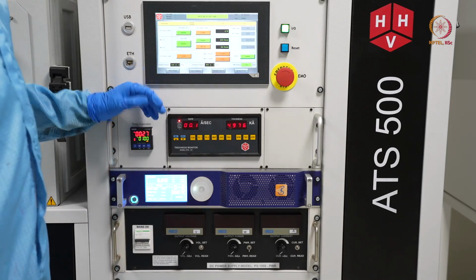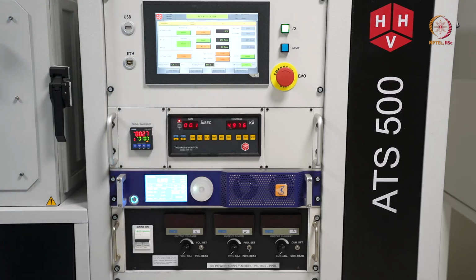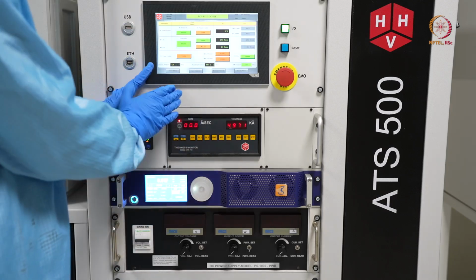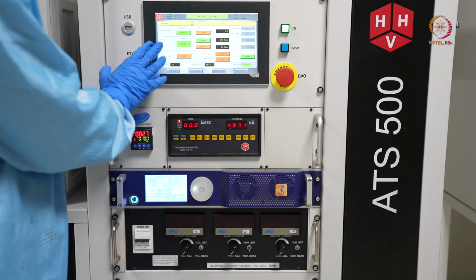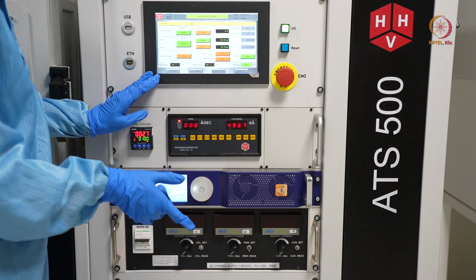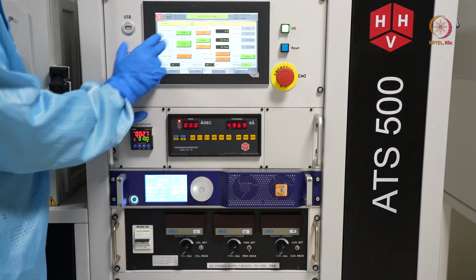As this is a metal, and aluminum is a softer, low weight metal, not a heavy molecular weight one, it will require a lesser amount of power. So we will set the power accordingly and show the things. Again, this time DC power will be off, so disabled, and this time we will switch on this magnetron 1. That is the basic. Now let us start.